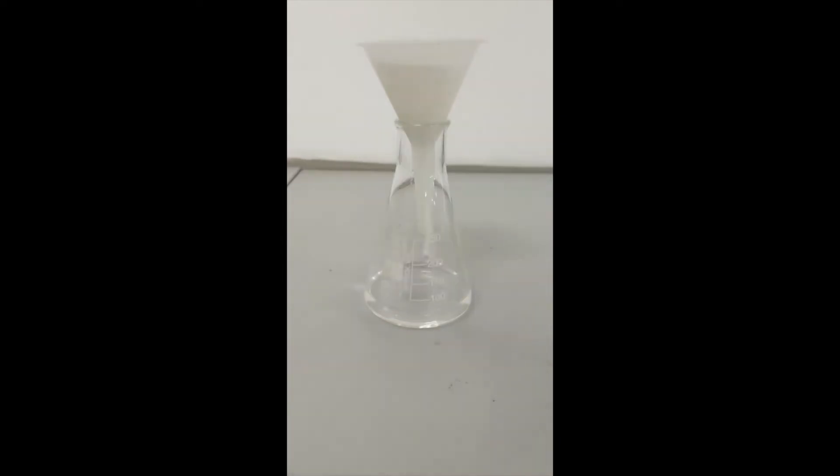And the filtrate at the bottom. This is the filtrate. It's the salt solution that was small enough to fit through the filter paper.